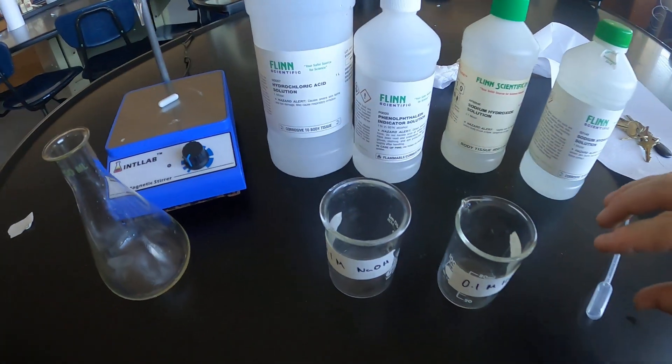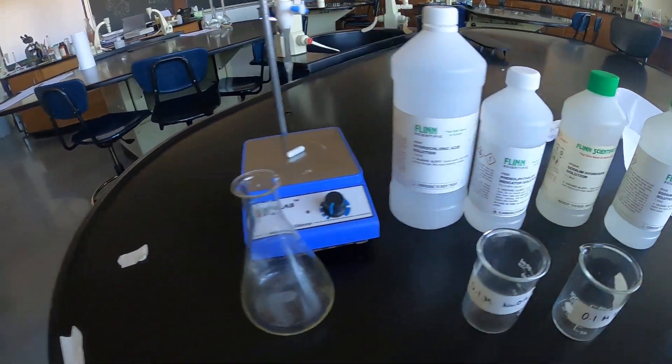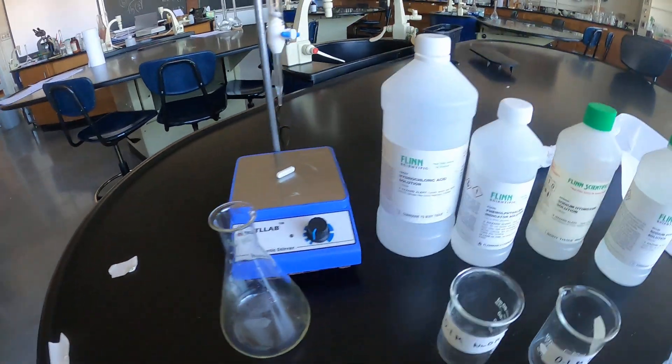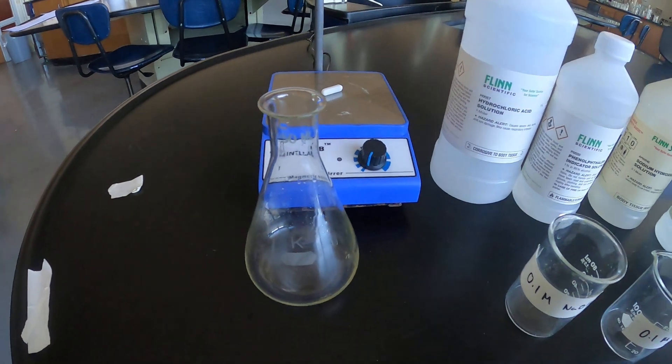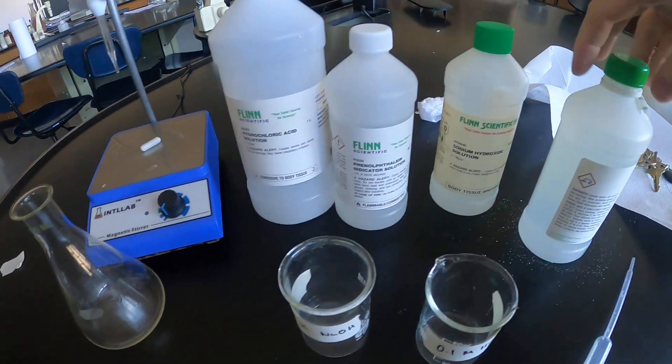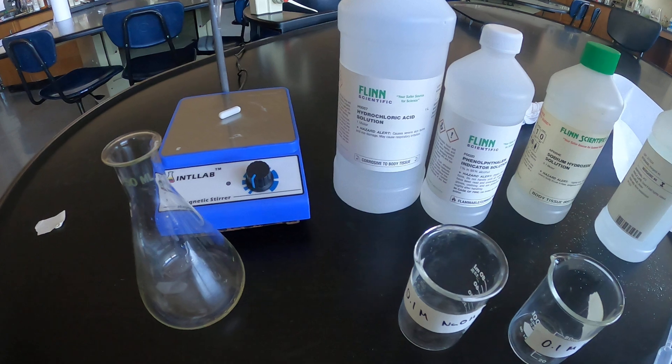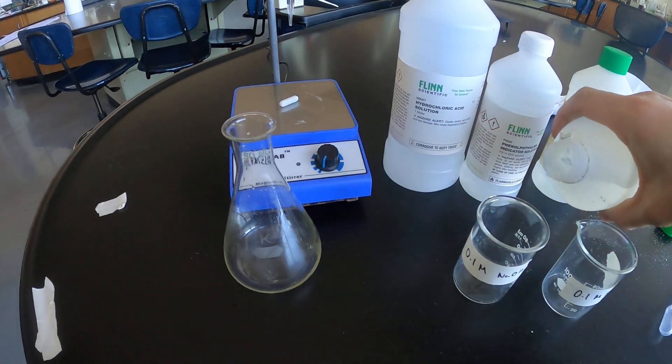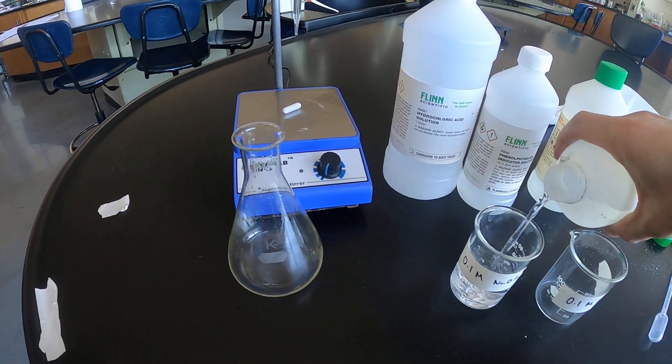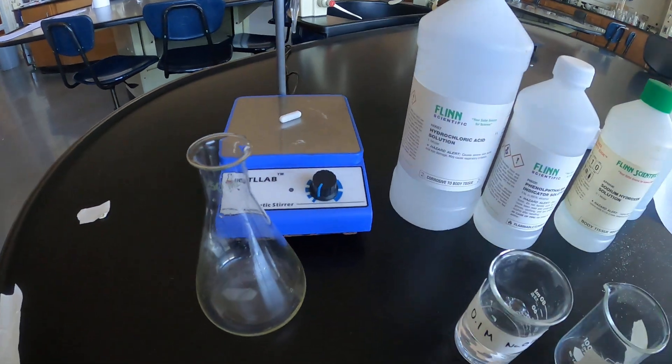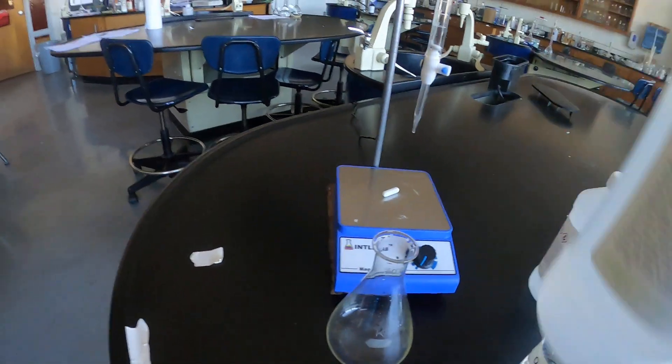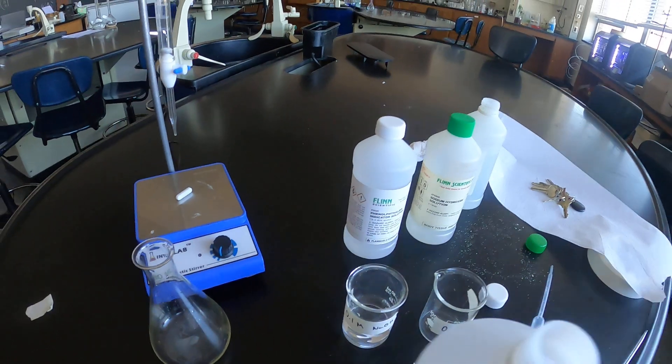In this laboratory we are going to titrate acid with base, therefore your base will be the titrant. First thing we're going to do is kind of dole out some base into these beakers. Do not pipette directly out of the reagent, that is a no-no. So portion off what you need and then come back and grab more if necessary.